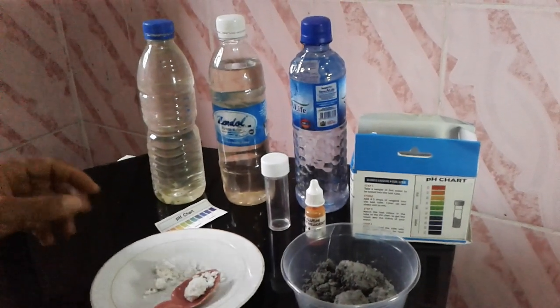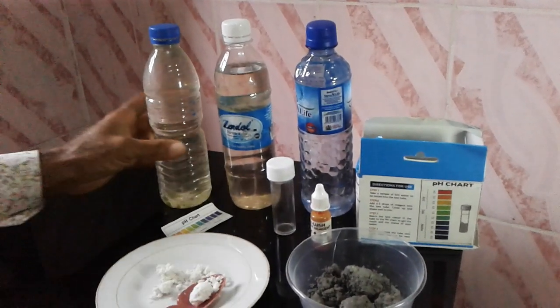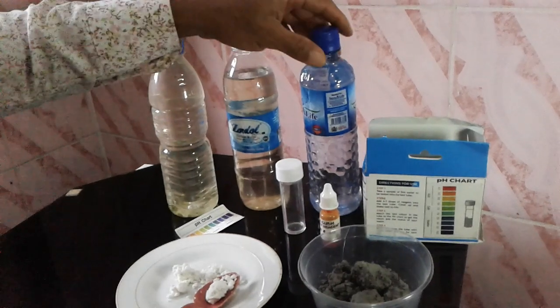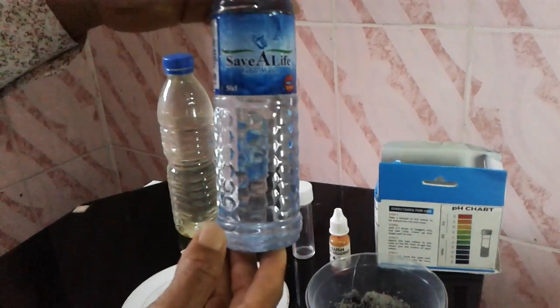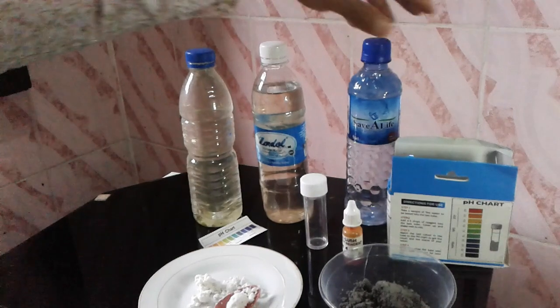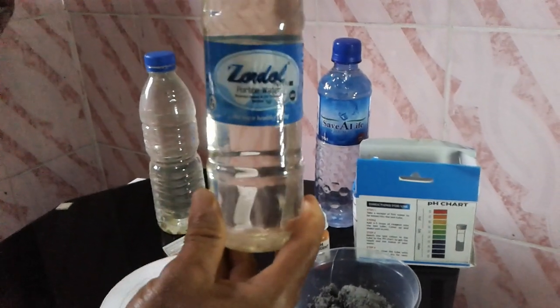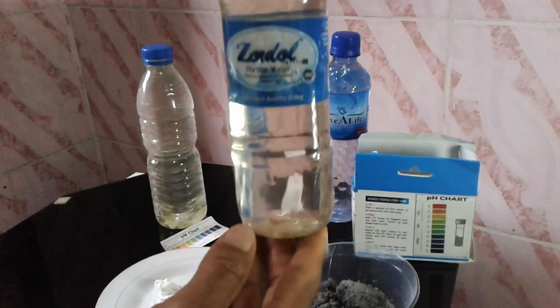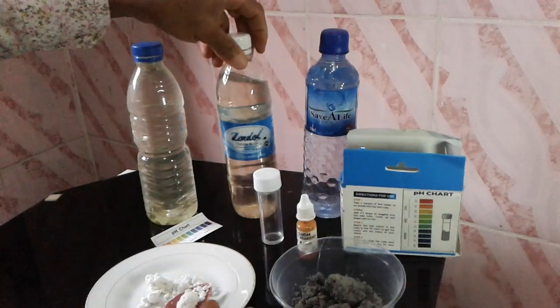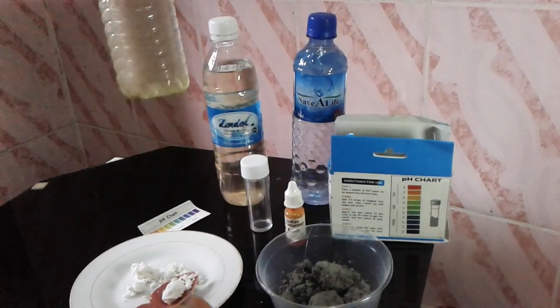Hello guys, welcome to Fish Academy. Today I'm in my office. For those of you that watched the previous video, I told you I'm going to bring back this sample from my farm to test it right here in my office. This is the water from my water tank at the farm. I also got water from the treated pond — that's a pond where I stocked dry plantain leaves. This water is from that treated pond, which is undergoing treatment right now. We're also going to test water from pond number six.